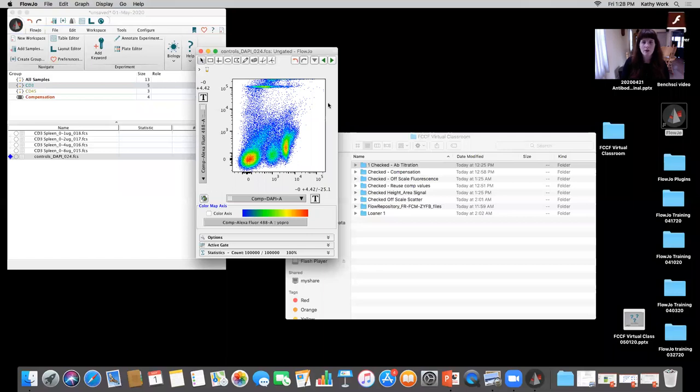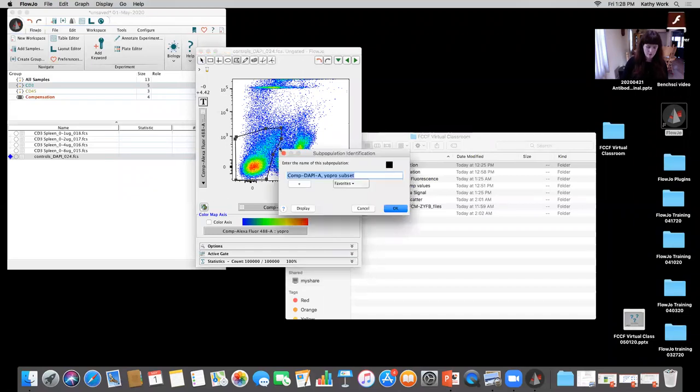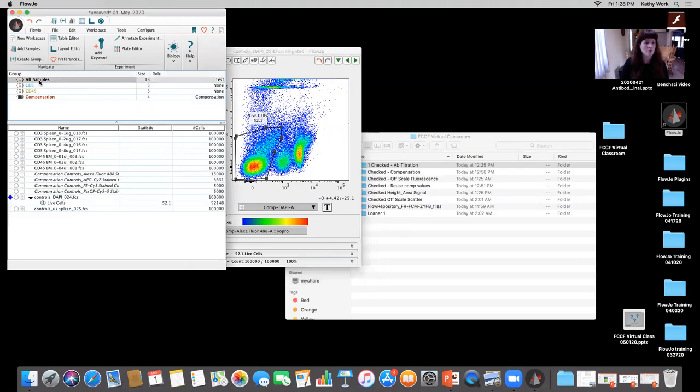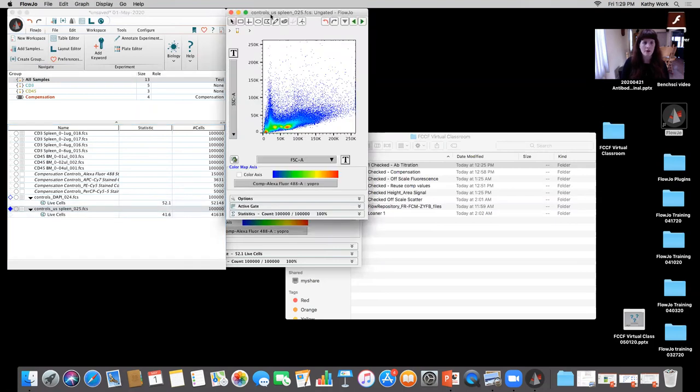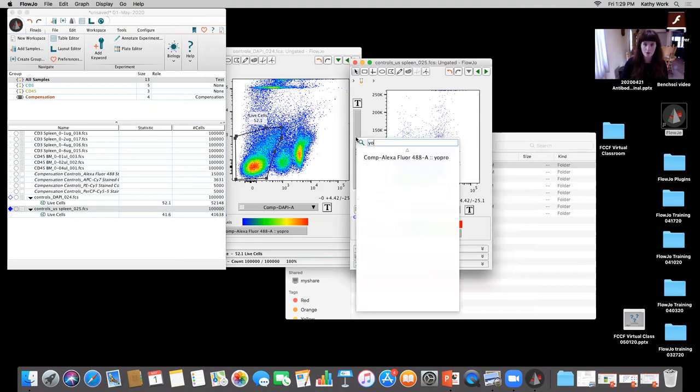Okay. So I'm gonna go ahead now and I'm gonna take a look at the live cells. I'm gonna do a quick polygon gate. Those might be some more autofluorescent cells. I'll include them. I'll close that up. I'm gonna call those live cells, potentially. I would love to reference my unstained spleen here. So let me just go back up to all samples. I'm not sure why it wasn't dragging into that group. And I can go ahead and open that one up just to make sure that with the unstained, that's an appropriate gating, because we always want to use the appropriate controls whenever possible.